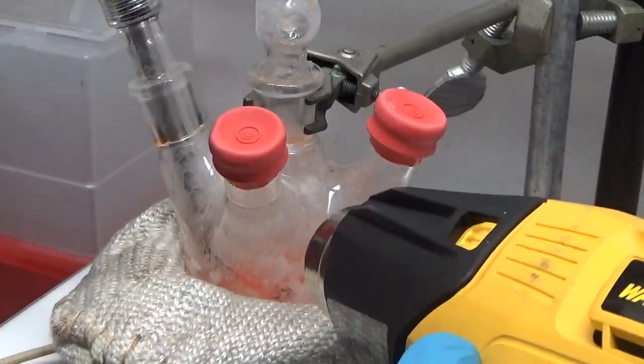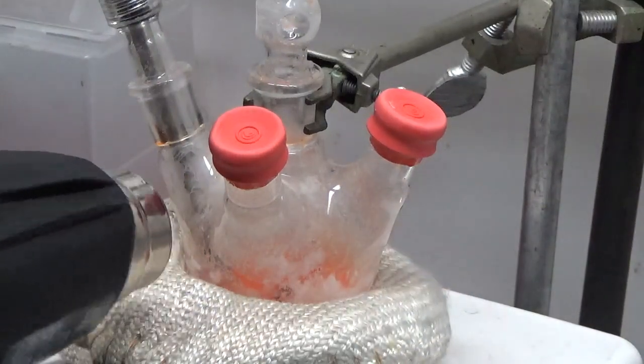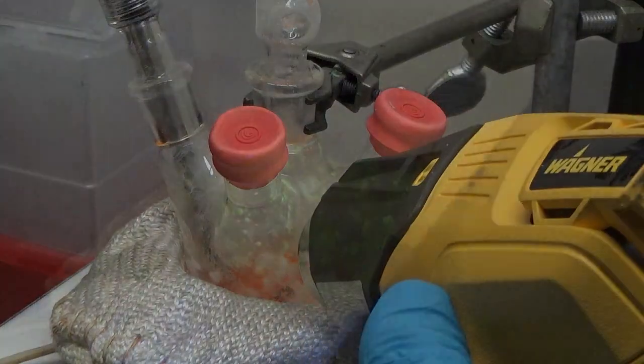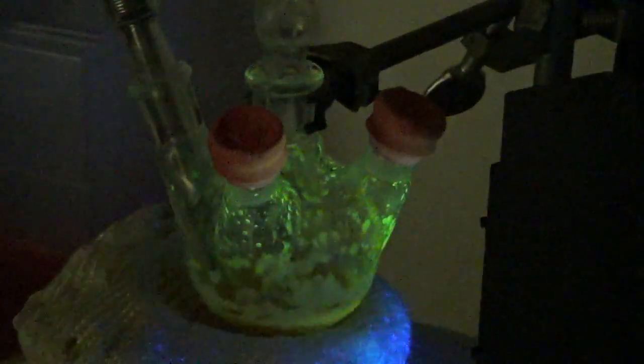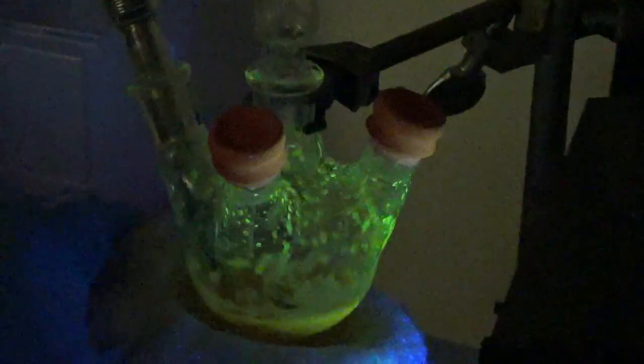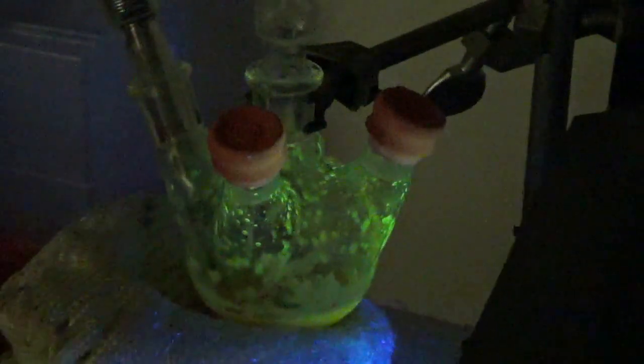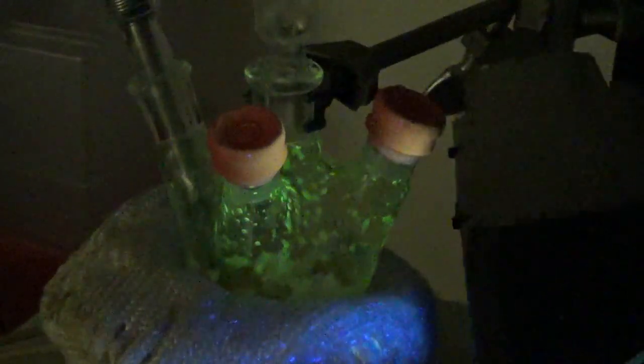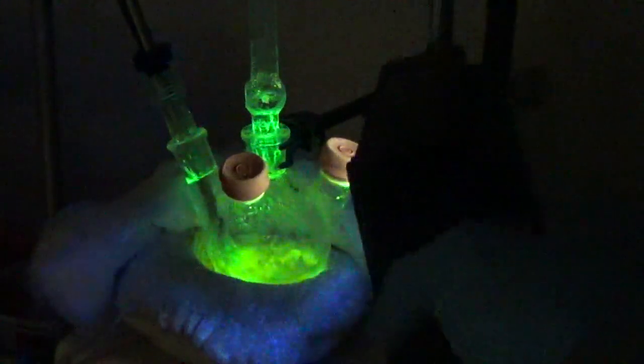It is best to leave this for several hours - usually I do this overnight. There's always the issue of the TOPO getting kind of splattered up along the sides of the four-neck, so I regularly heat gun that off. Really important to do when you're actually overcoating. We're still in the preparation phase here. The decylamine is really doing a number - it brightens the dots considerably. This is really kind of an artificial brightness. If you take those dots out and pretend that they're overcoated and precipitate them and try to use them, they'll actually lose all their brightness by the time you're done processing them. That does not happen with core-shell dots, and that's why we make core-shell dots. They get brighter and brighter as time passes, and I recommend several hours overnight. Just do it overnight and that way you just don't have to think about it. The brightening is dramatic.